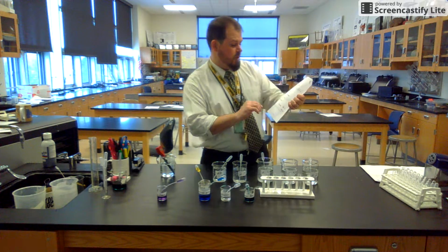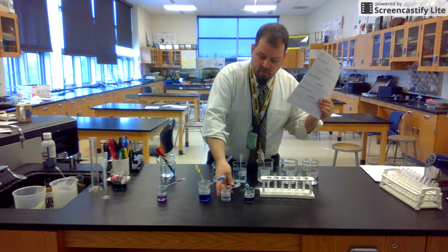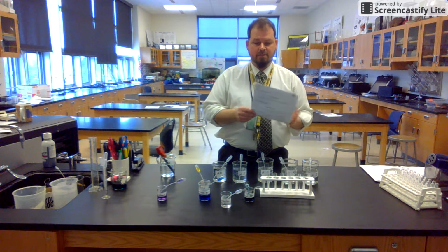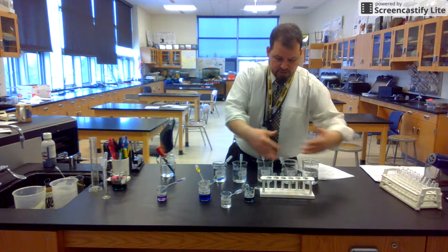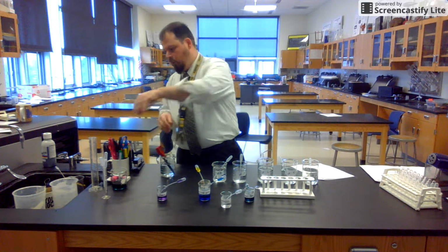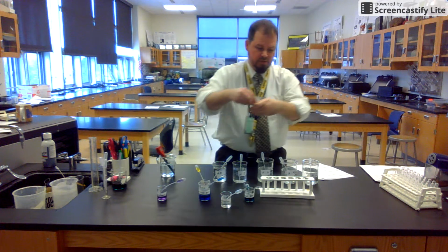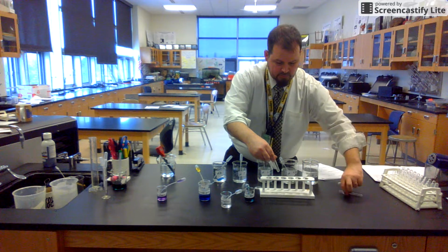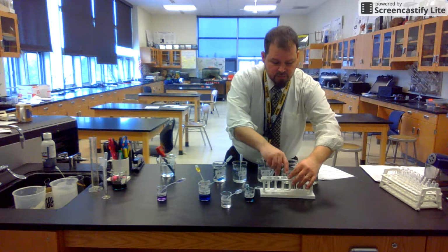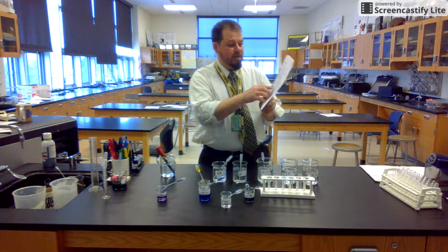I need you to put a note under phenolphthalein. Phenolphthalein, this clear one, even though it's the 3rd one on the list, we need to do that one last. And here's why. When you are done, all 3, you're going to dump them in the waste beaker. You are going to carefully rinse them with some water 2 to 3 times and bring them right back without dropping them and breaking them. Okay, and we're going to reuse them, the same 5 for the whole lab. So phenolphthalein, put a note, please.